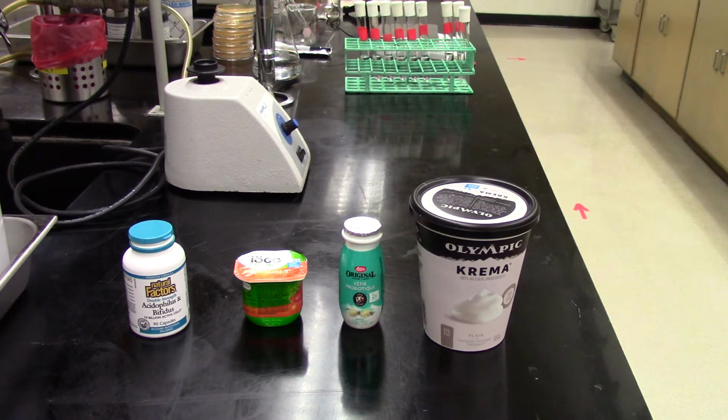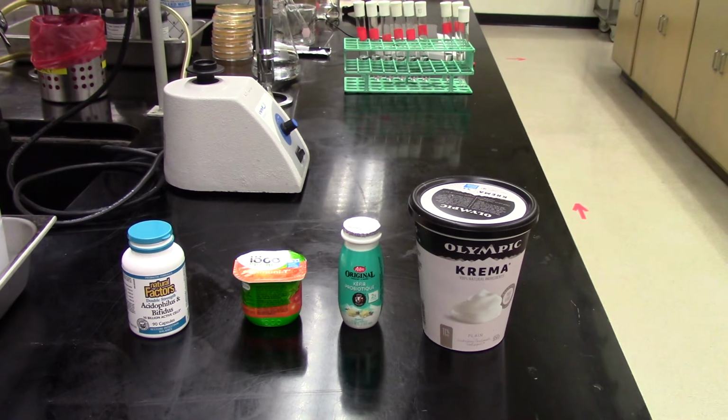those diluted samples. There are other things other than E. coli cultures or other cultures that you can also enumerate the number of microbes in. So you will be looking at E. coli in the lab and enumerating a culture of E. coli using spread plates and pour plates.